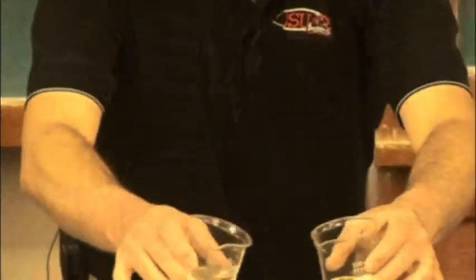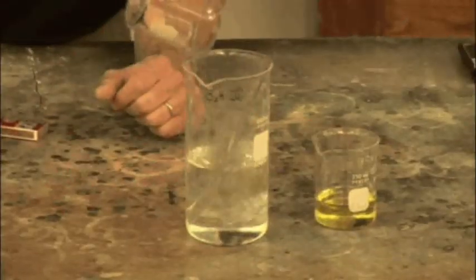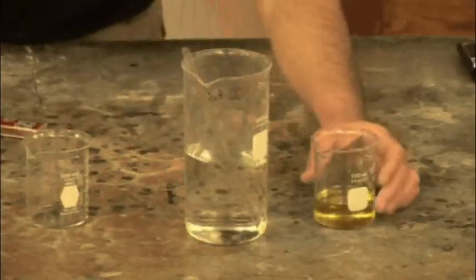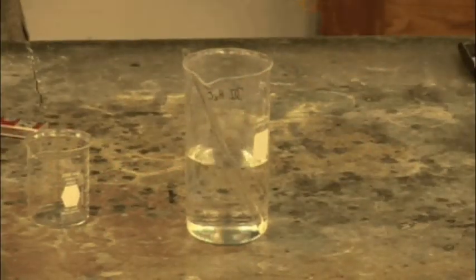So I'm going to mix these in. Let me pour in the lead nitrate, give it a little mix. And I'm not going to mix for this, I'm just going to pour in the potassium iodide.